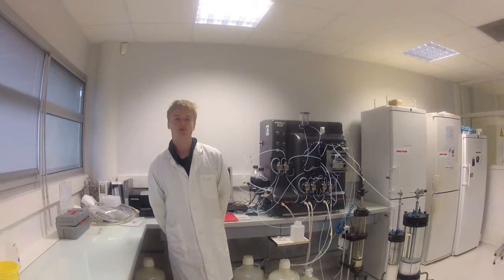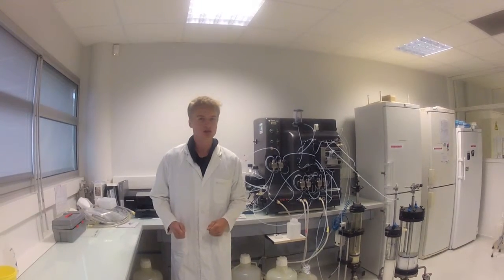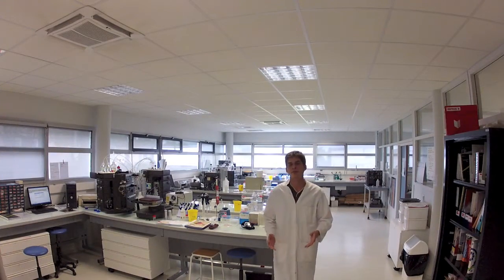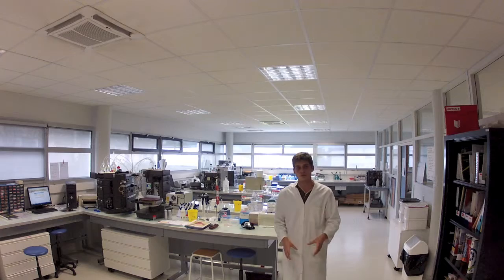In industry, the purification process represents almost 50% of the production cost. So optimization of the purification is a major issue for biotechnological companies. ENSTBB is one of the most fully equipped schools in Europe in the field of purification. Most of the machines you can see here are used by the industrials.